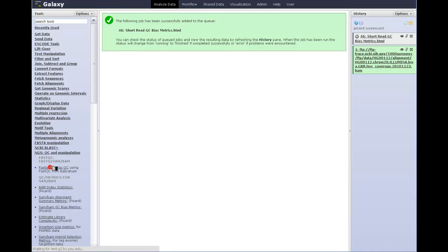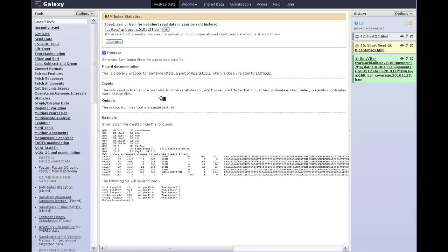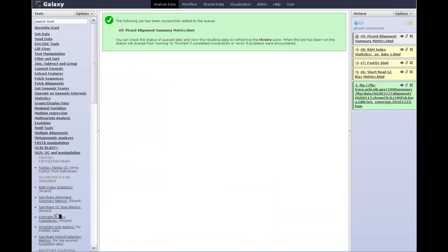going. I'm also going to run the Fast QC tool from Babraham Bioinformatics. Again, I'm just going to accept all of the options. I'll also run the index statistics tool from Picard, which will show us where the mapped reads have landed on the contigs from the reference. Let's run alignment summary metrics. Again, I'm just going to accept all of these defaults, and we're just going to run it on the one BAM file I have in this history.